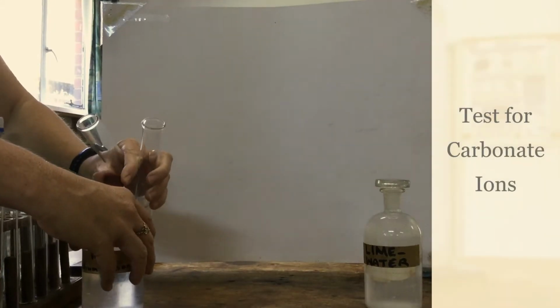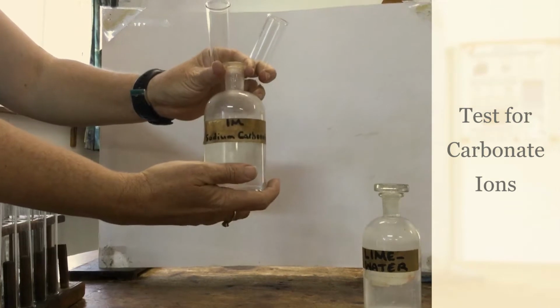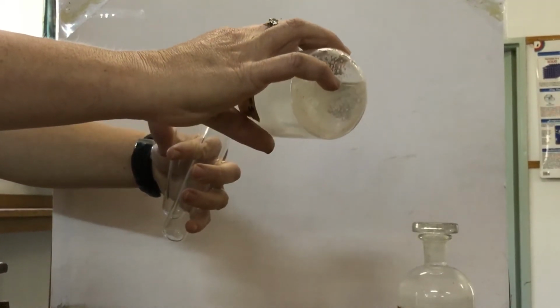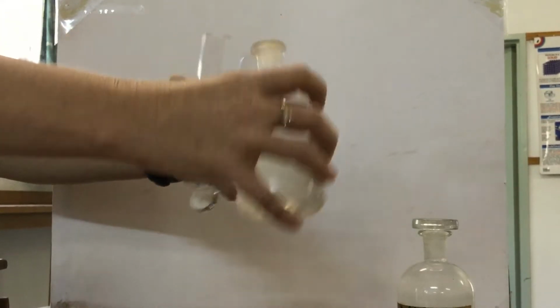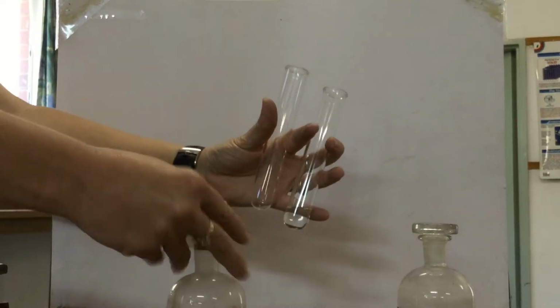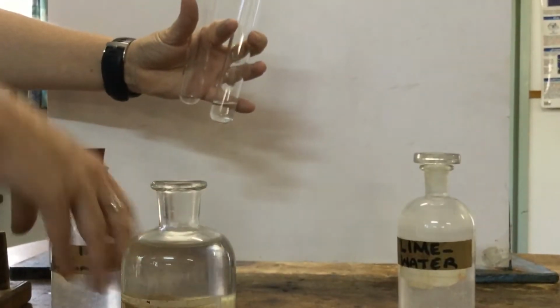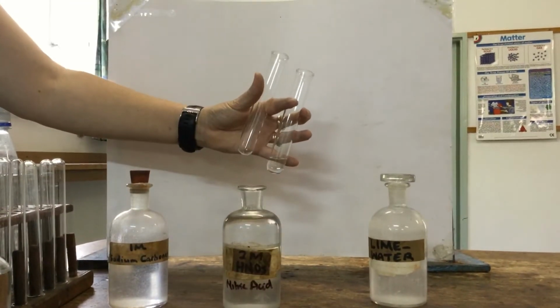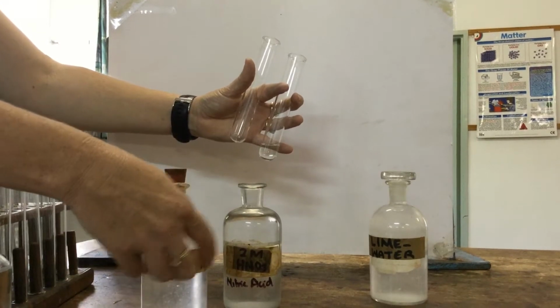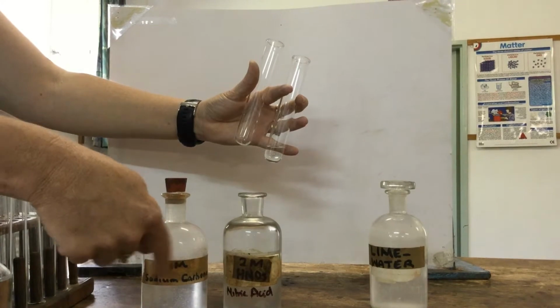Okay, the first anion test that we're going to do is for carbonate anion. So we've got some sodium carbonate. I'm going to put a small sample into a boiling tube. The test for carbonate is just to add some dilute acid, and I have some dilute nitric acid here. The result of the test will be that carbon dioxide is produced when an acid reacts with a metal carbonate.